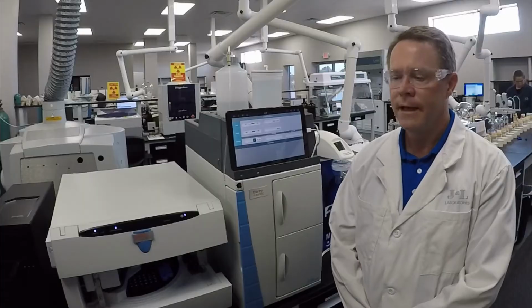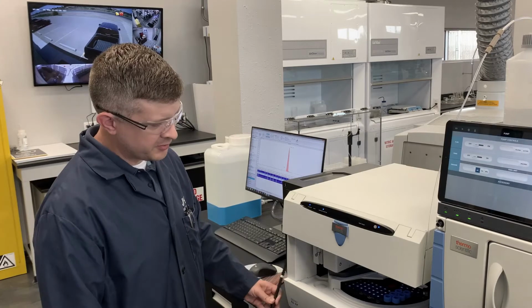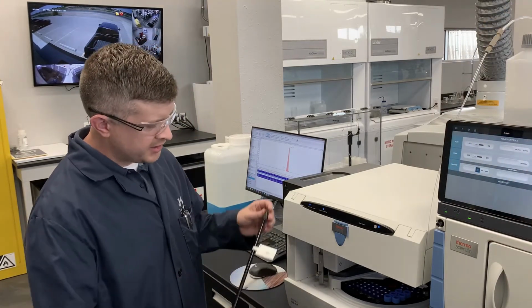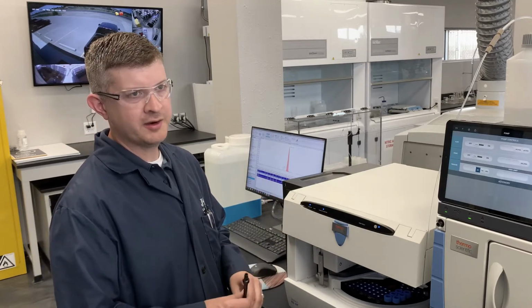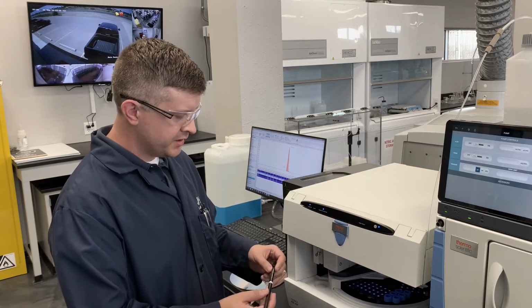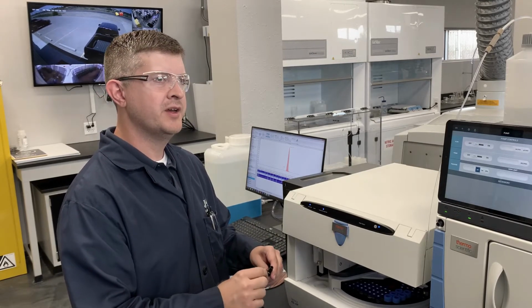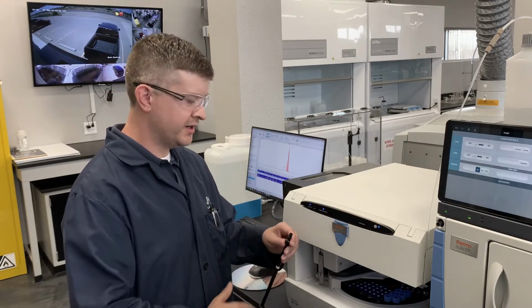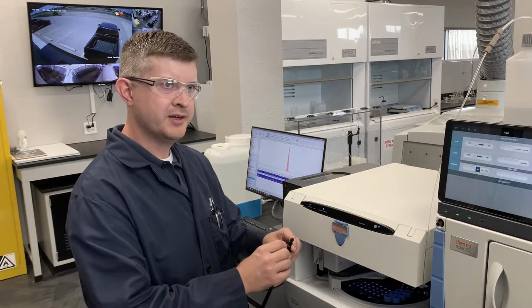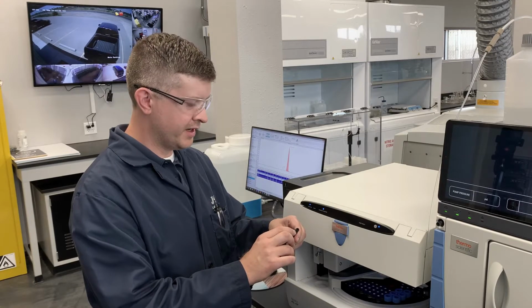Can you tell us a little bit about the instrument? So the instrument here, like I said, is the Thermo Fisher Dionex Integrion HPIC. And it uses the principle of ion chromatography to separate species that are of interest to the customer. So the sample all arrives in one slug onto the column. It's pushed through by an eluent at a particular concentration, a particular flow rate, and it'll cause the different organic acid species to separate in the column.